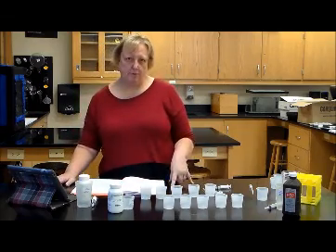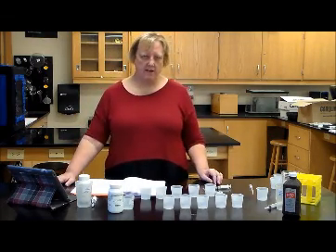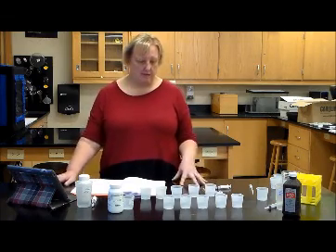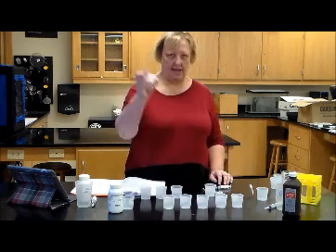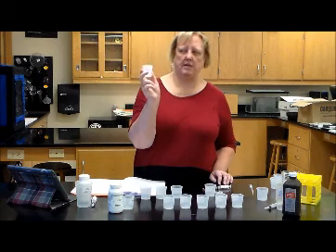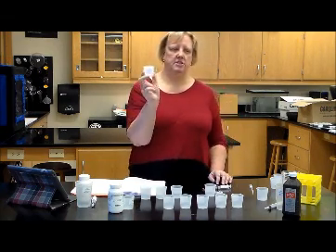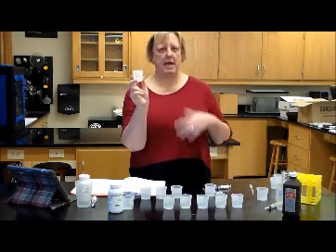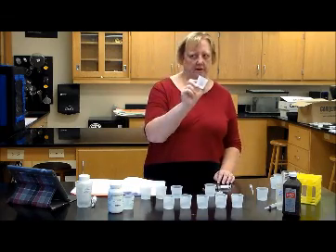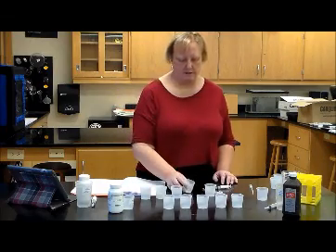Activity C, you're going to set up on Wednesday, but you're actually going to do the actual work on Thursday. So go ahead at the beginning of the lab and set up activity C, because you will do that overnight. There is a cup labeled H2O2 overnight, because like I said earlier, hydrogen peroxide decomposes naturally into water and oxygen. It's just that the enzyme catalase makes it happen faster. So what we're going to do with the overnight one is just put some H2O2 in there and see how much of it has decomposed overnight.